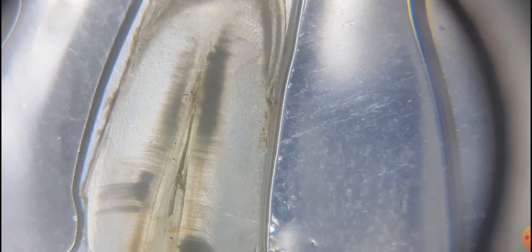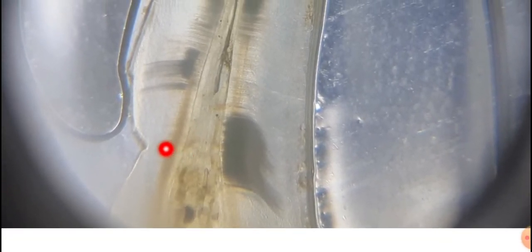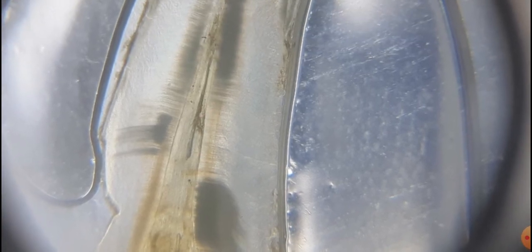Here this is the central core, the pulp cavity, it contains the blood vessels. Then the connective tissue, it is the mucoid type of connective tissue present in the pulp cavity. We cannot identify this mucoid connective tissue here, only these three gross parts: the enamel, dentine and the pulp cavity. Here is the neck, and here is the root portion. At the junction of the pulp cavity and the dentine, there is the layer of the odontoblastic cells, but we cannot differentiate the different layers here.